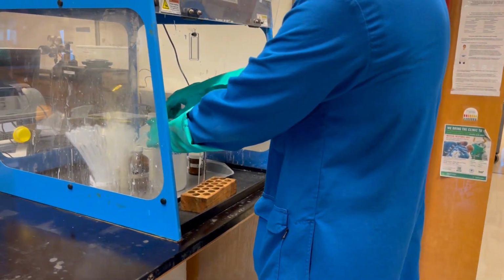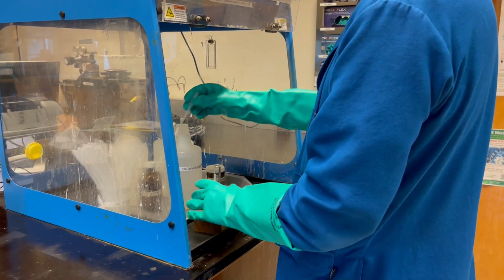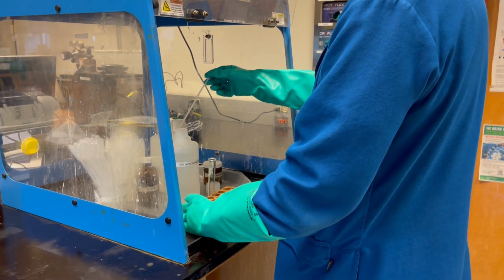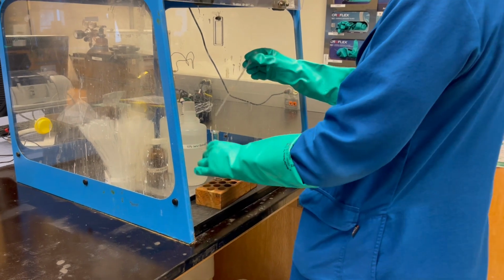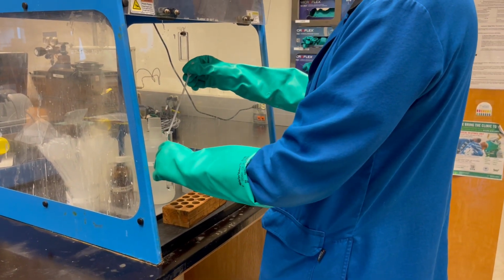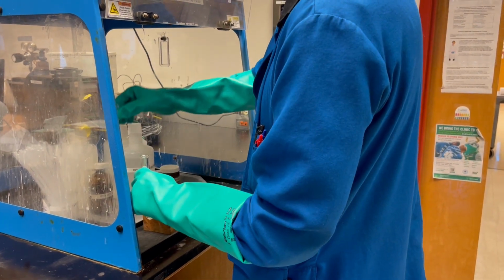So assuming that this was my iodoethane or iodomethane, we can open this up and go ahead and transfer directly from our secondary container into the test tube that's inside of the test tube rack. Do not hold this in your hand, because there's a chance that if you do hold this in your hand and make this transfer, that if you miss and get some on your gloves, it will leach through your gloves, and that needs to be avoided.